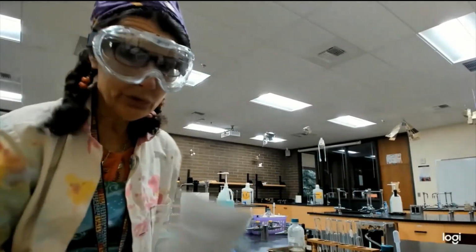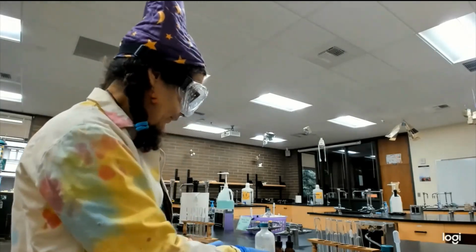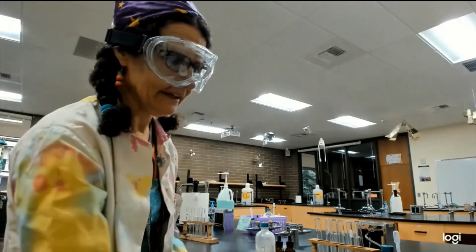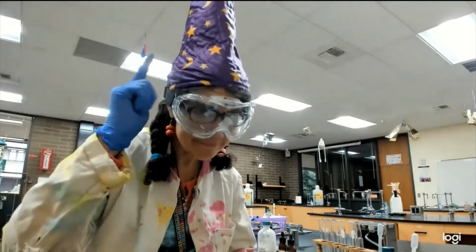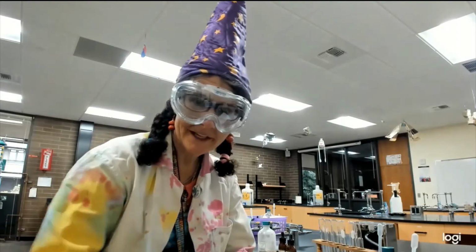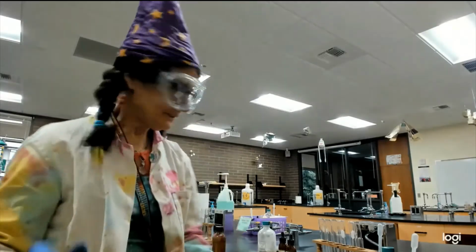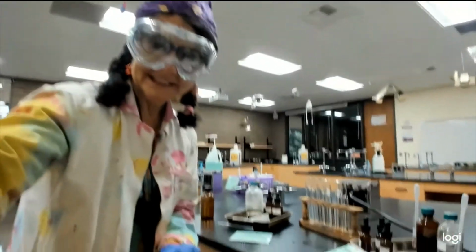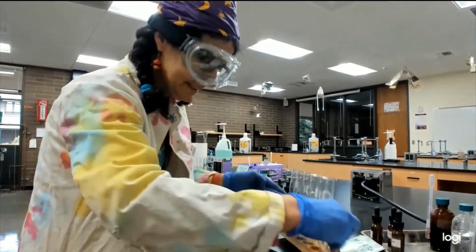We are going to do 2 tests to see what type of alcohol we have. We have the Lucas test and, you know, not very important. So the computer screen just went blank and you guys were gone. So it was a very exciting test, and I just realized I keep putting the camera on me, and it's not about me at all. It's about the test tubes.